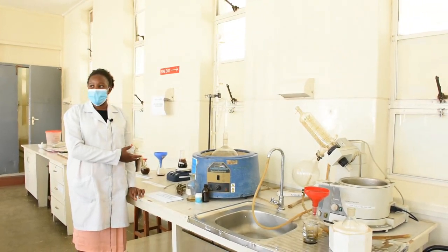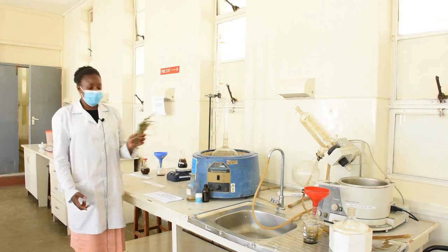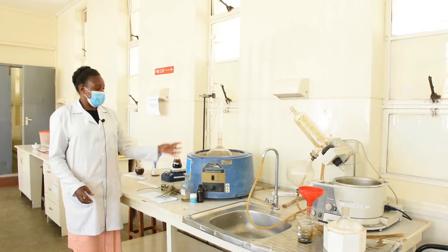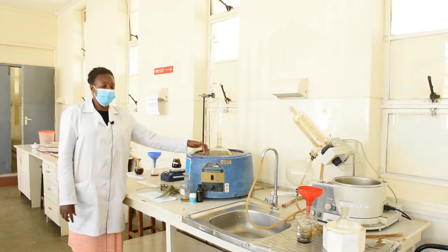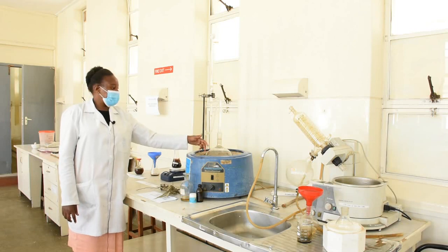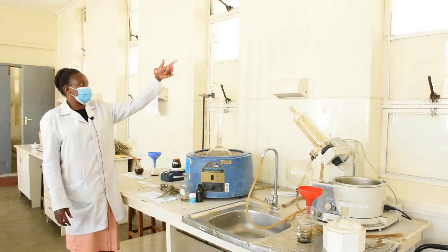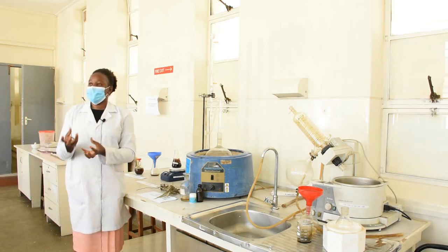We can use this distillation method for materials such as eucalyptus. We know eucalyptus oil is a volatile oil, so we pack the eucalyptus material, add the extracting solvent, boil it, and collect our oil above the solvent — because the oil will be lighter.